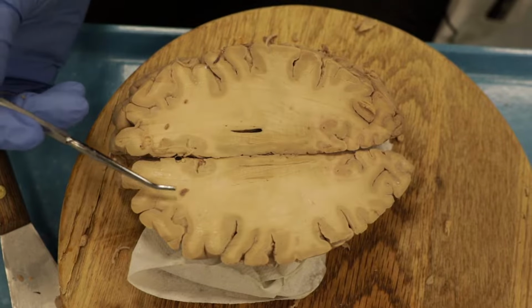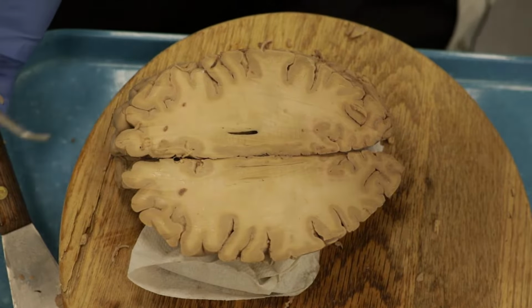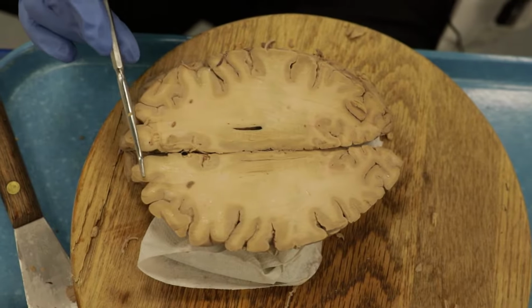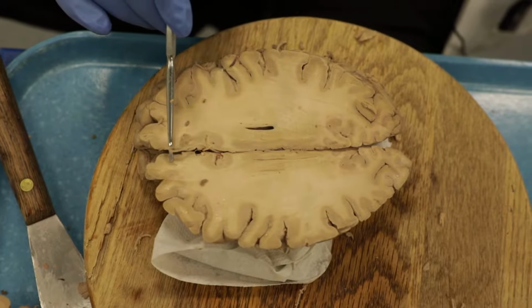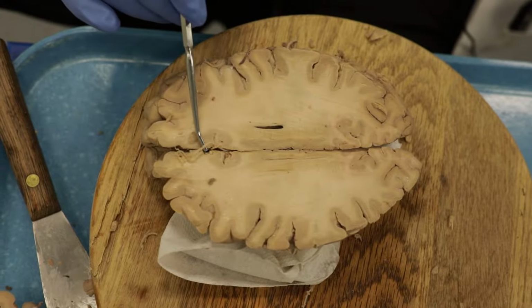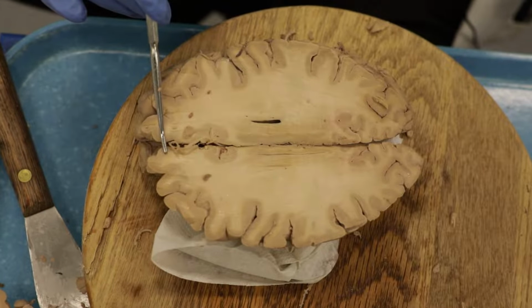So this is the frontal lobe, and as you do these cuts, you'll always go back and orient yourself. What is front? What is anterior, posterior, and so on. But this is frontal lobe up here, and this is the Cingulate Gyrus. So, what blood vessel did we see traveling right over the Corpus Callosum by the Cingulate Gyrus? This would have to be a branch of the anterior cerebral artery right here.